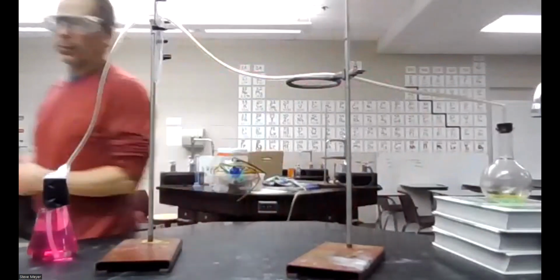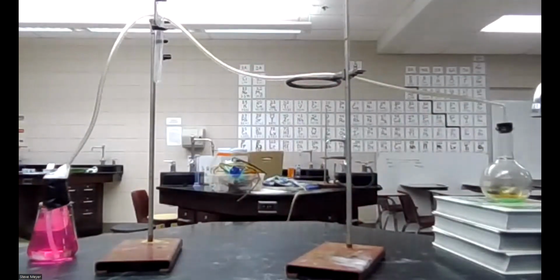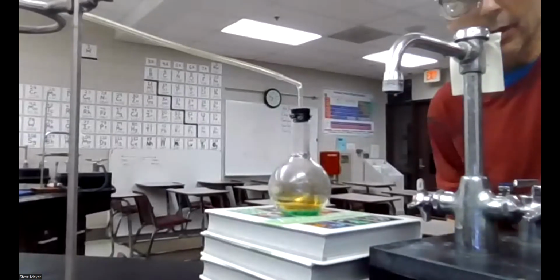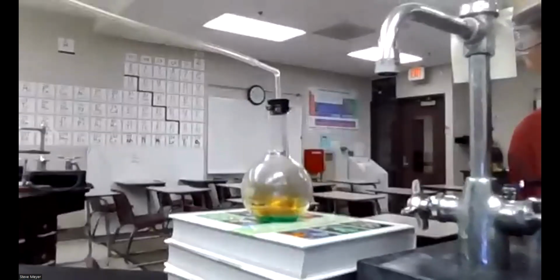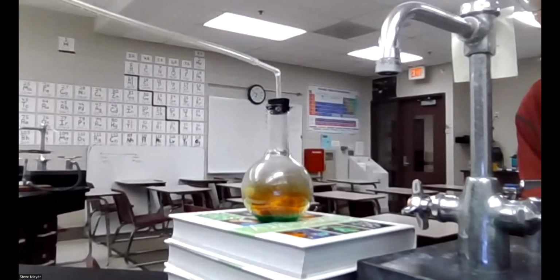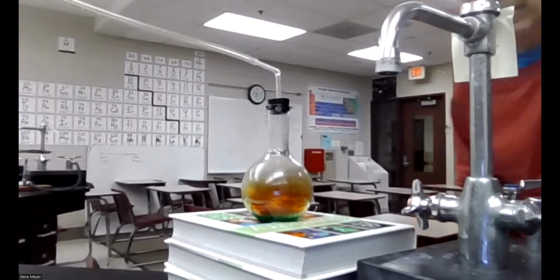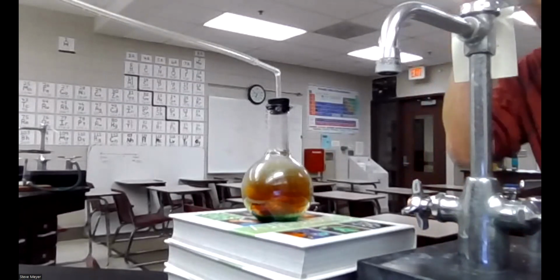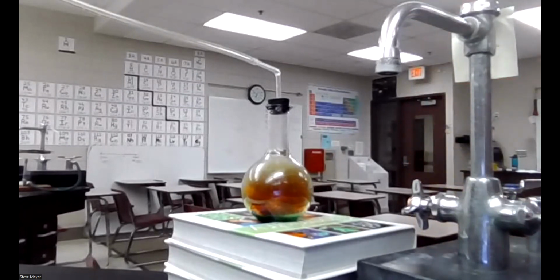We'll bring the computer up a little closer so you can see, but it's starting to get green. You can see that from there. I think you can see that. And then there's an amber hue coming out of it, and that amber hue is a gas, and it's nitrogen dioxide gas. Now, one of the other products is also water, which is, I think, pretty believable from this. And then a third product is copper nitrate, which we don't have any evidence of now, but we will at the very end of the experiment.